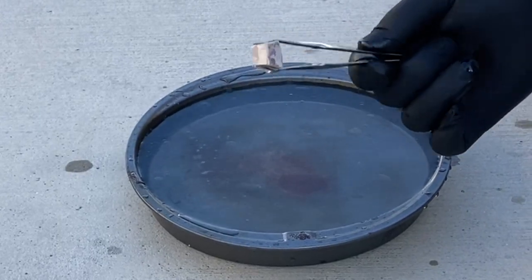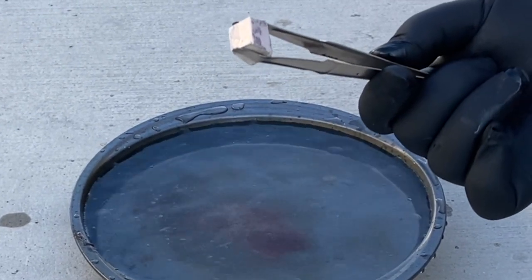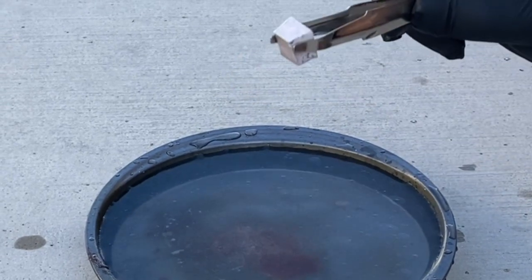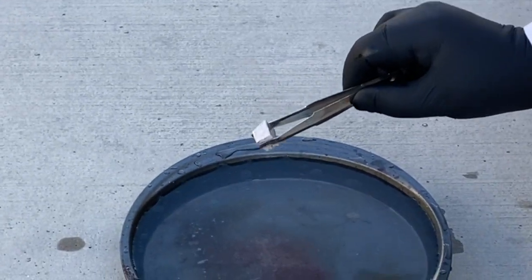All right, now we're putting in a second piece. It's about twice the size of the first piece. So you saw what happened with the first piece. It's almost like fireworks, a little bit of an explosion, a little pop. Now that it's bigger, what's gonna happen? Well, I'm gonna stand further back. And so am I. Okay, we're getting back out of the way.